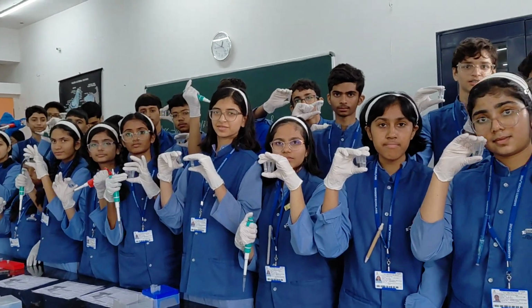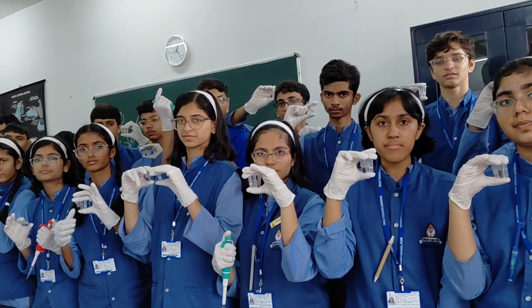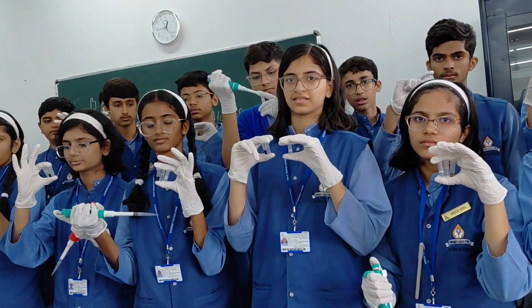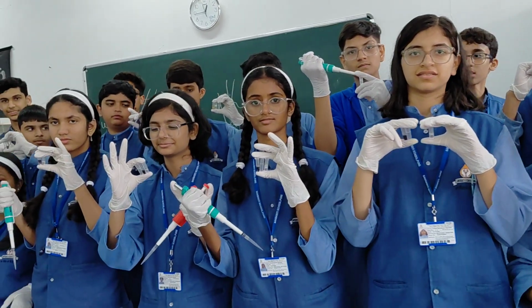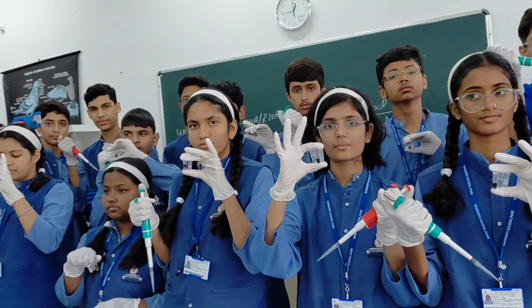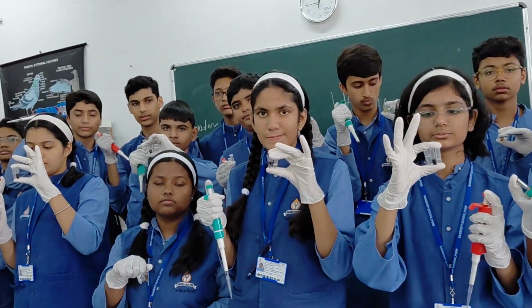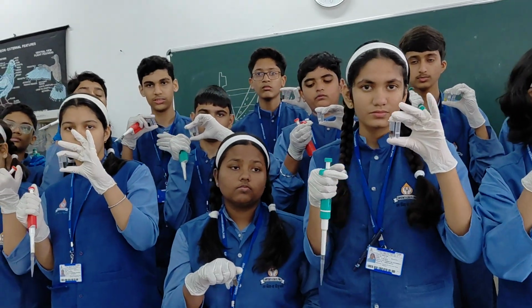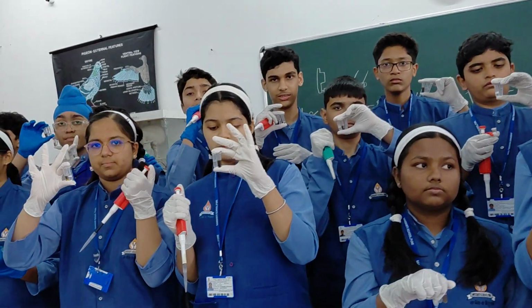There are 7 total steps in the DNA experiment. First is sample selection, second is sample homogenization, third is cell lysis, fourth is protein precipitation, fifth is DNA precipitation, and sixth is DNA desalting and washing.